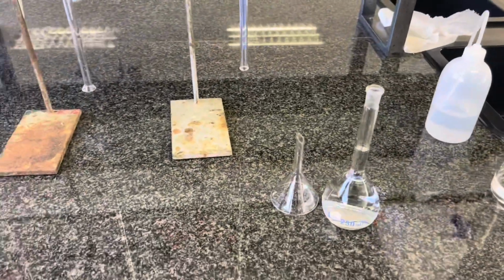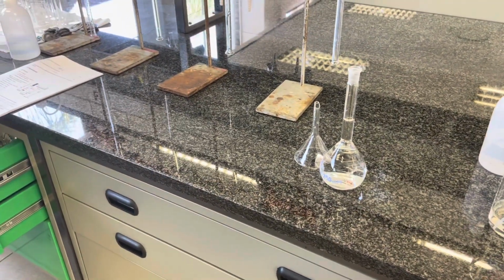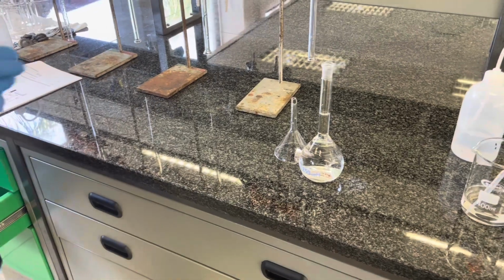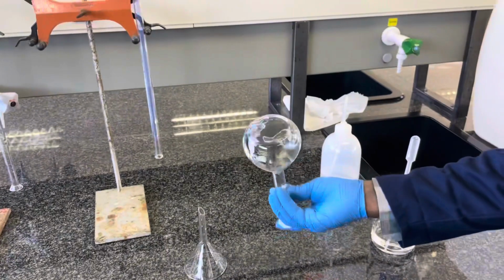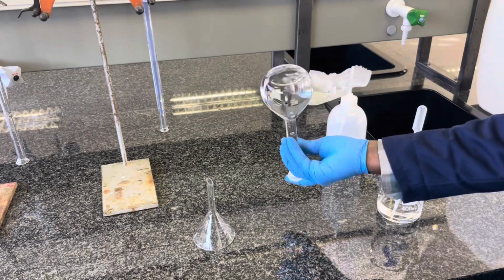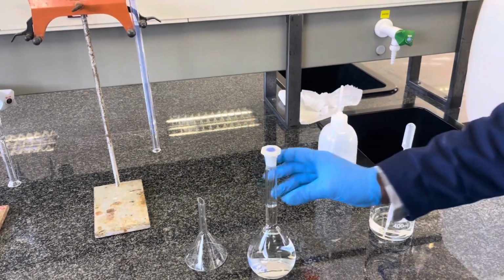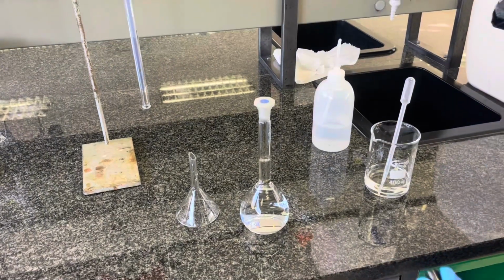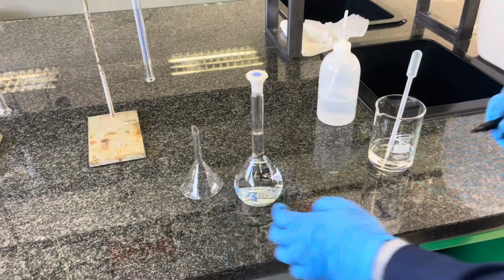Of course, before you completely start stirring or homogenizing your solution, ensure that your volumetric flask is stoppered with a correctly sized stopper. To homogenize, simply tilt and twist to ensure that you capture all the little droplets that were left in the stem of the flask. Thereafter, always ensure that you mark your glassware with an appropriate marker.